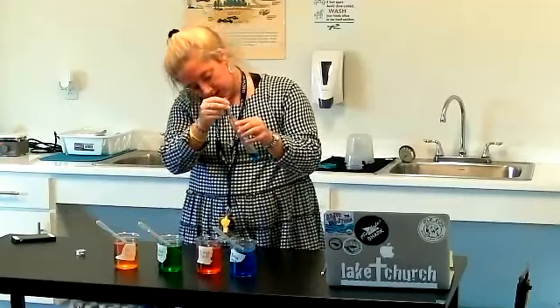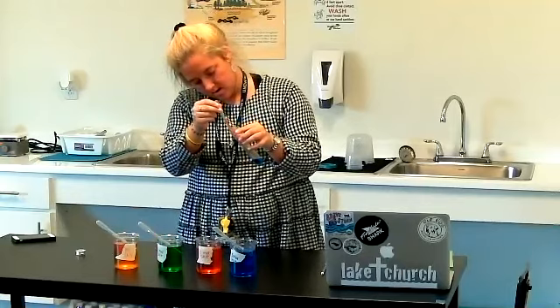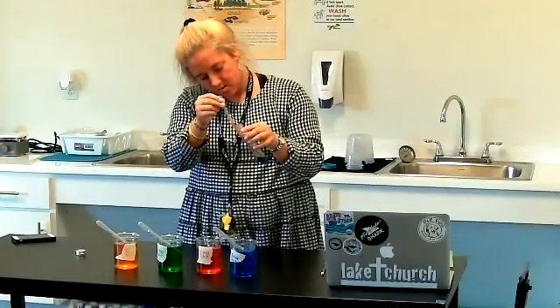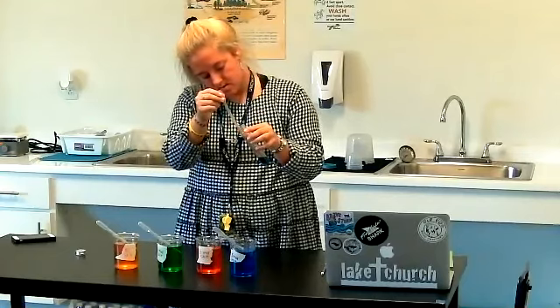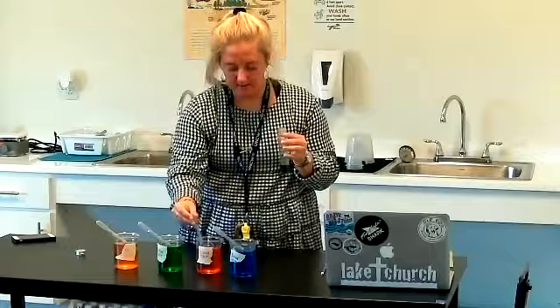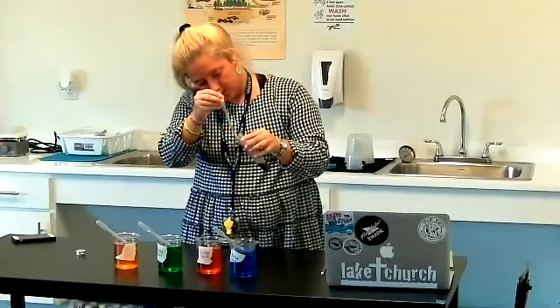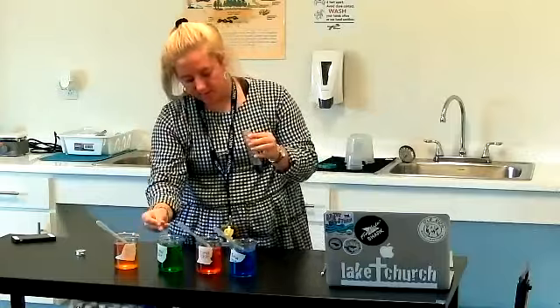Next I'm going to pipette the next liquid into the water. I'm going to pipette it really slowly and see what happens. My red liquid is in there. I'm going to add just a little bit more so we can see the end results. It's really important that you put it in slowly. So I keep going down the line — now adding some green.